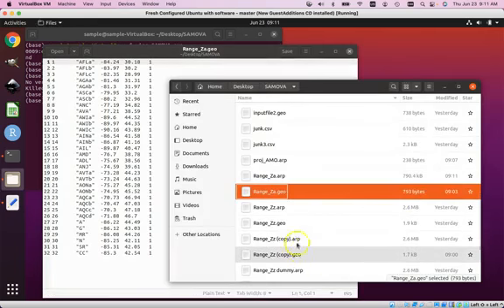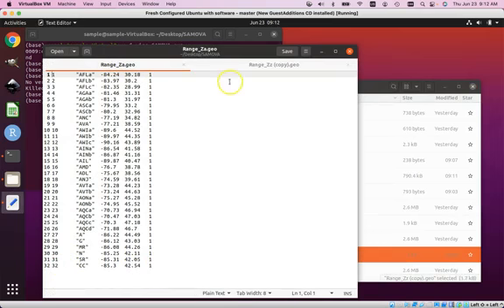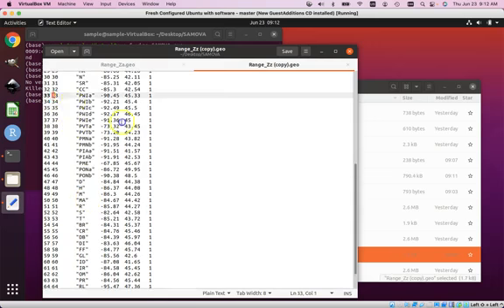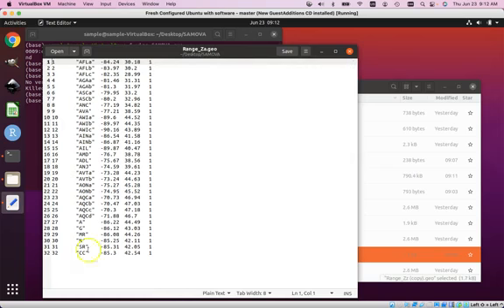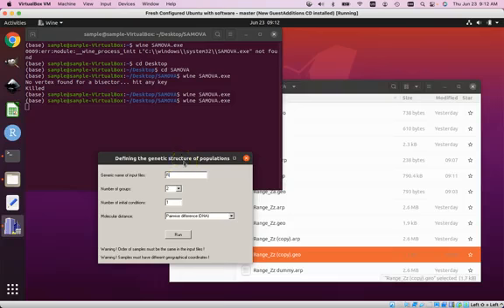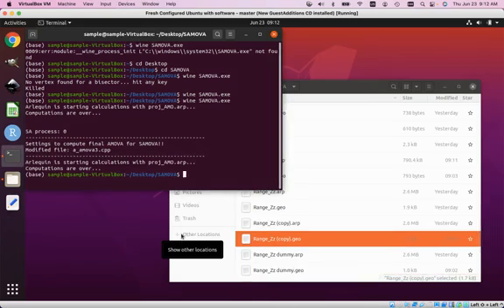let's compare it to the original geo file. So what he did was, if we look at number 32 on this list, it's CC, 32 on this list, so he cut off all of these individuals here. So again, we're going to look now at Dan's smaller data set that only includes 32 individuals, where he just randomly cut out the individuals numbers 33 through 68. What he found was that it runs. So there's something about that larger data set that was preventing it from running properly.